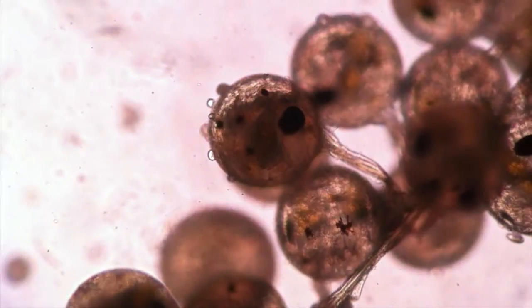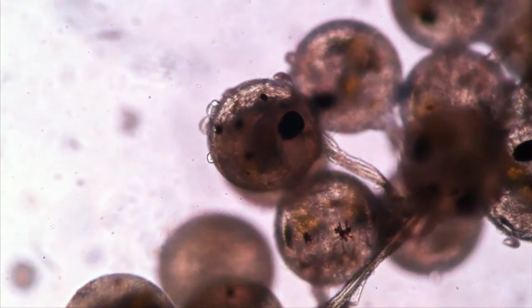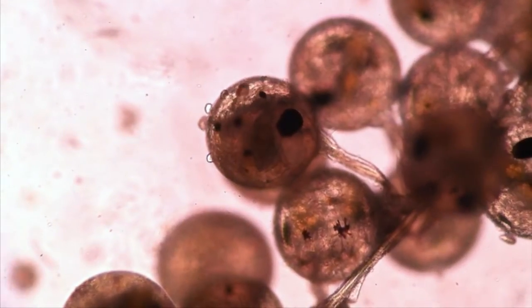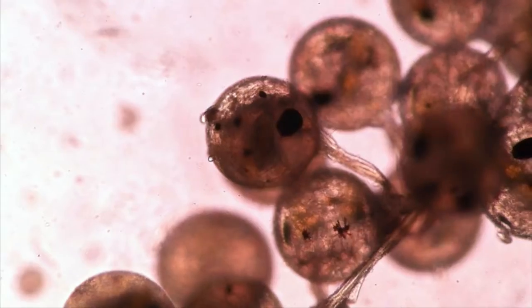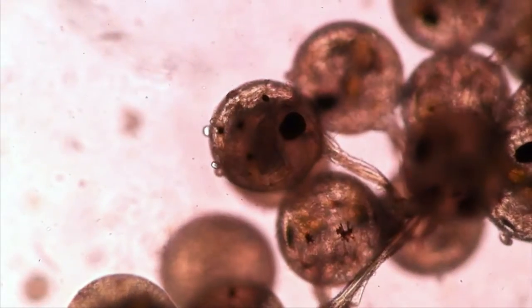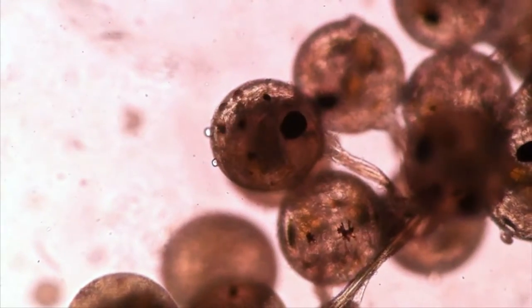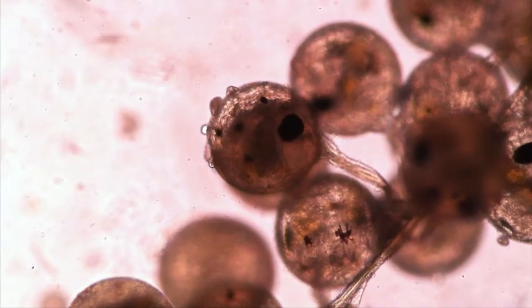I'm not exactly sure what type they are, but it's just kind of interesting to me that in this tiny little cluster of eggs, we still have all these little ciliates crawling all over these eggs. They're all over the place.